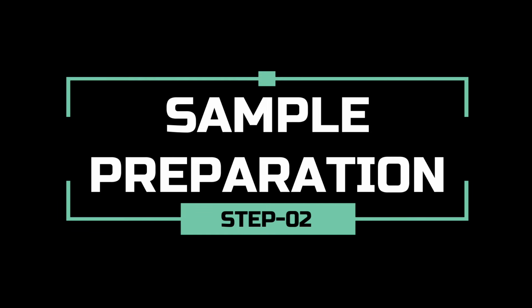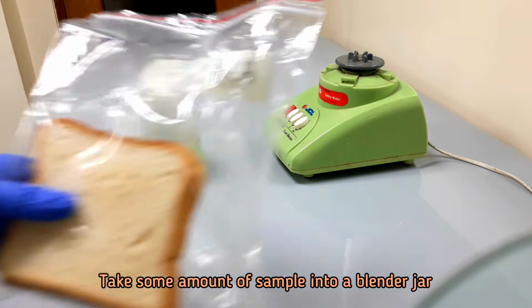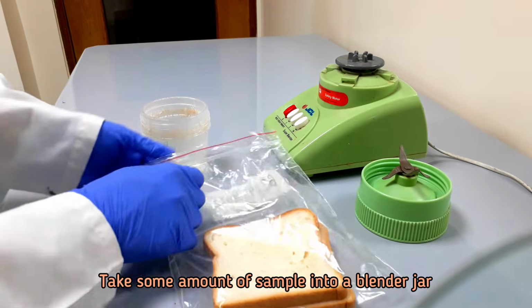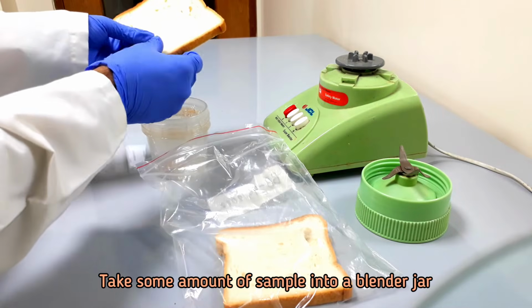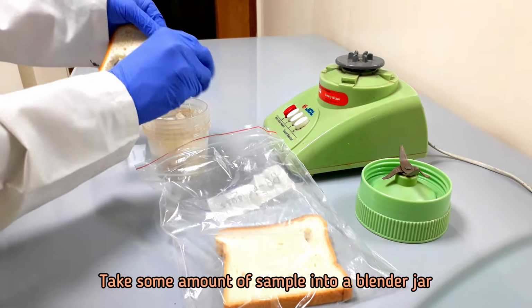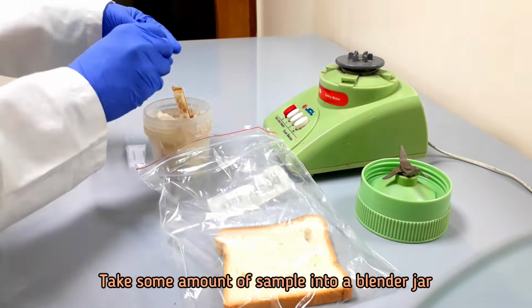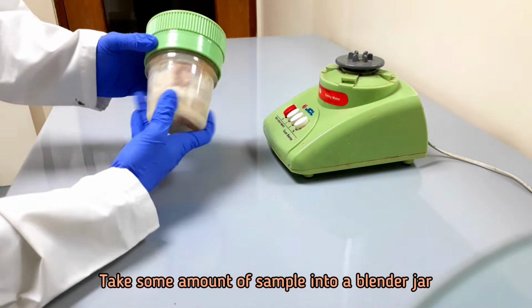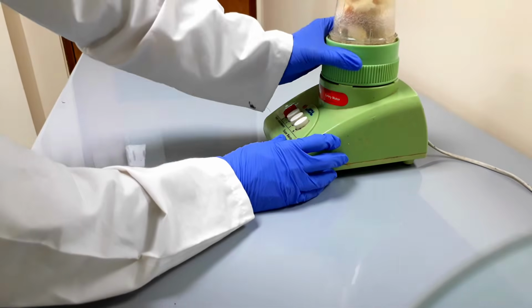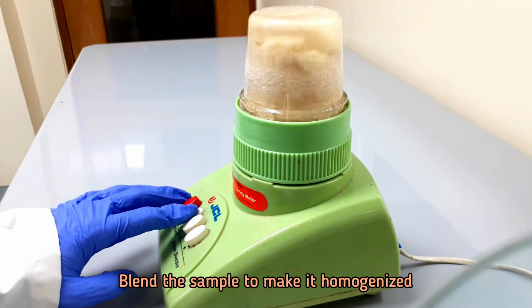Now we will prepare our sample. Take some amount of sample into a blender jar. Blend the sample to make it homogenized.